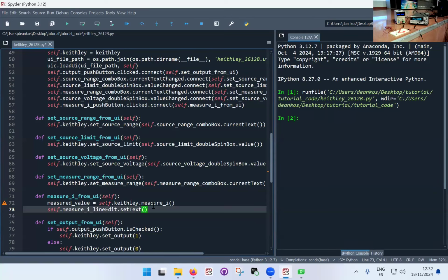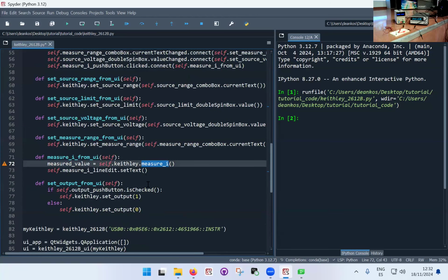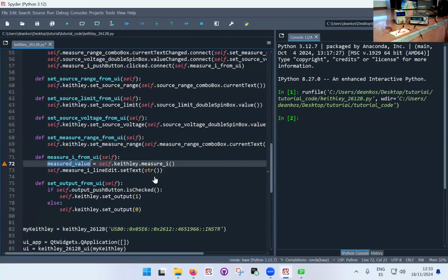and here now it is important to actually convert this into a string because we have implemented the Keithley to return a float, if you remember. So here we return a float. So in this case, the Qt is doing its own business, and it's expecting text. So if I give it a number, it's a variable type that it doesn't recognize. So we need to convert. I can do it here or wherever. str is just a string conversion. It's just the Python syntax. So I'm just going to copy this and paste it right here, the measure value.